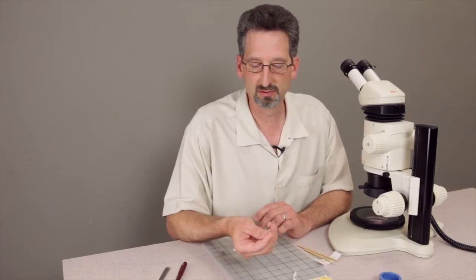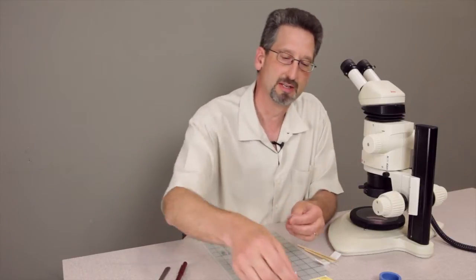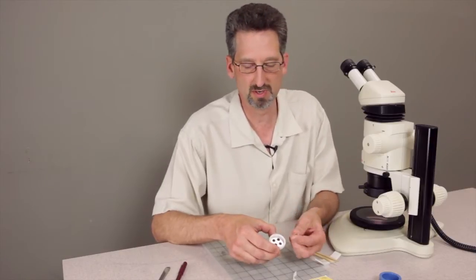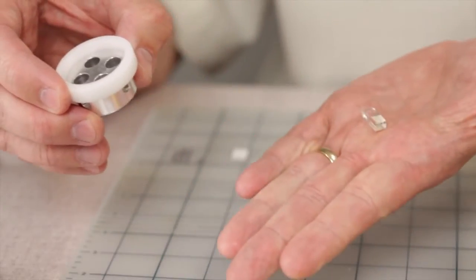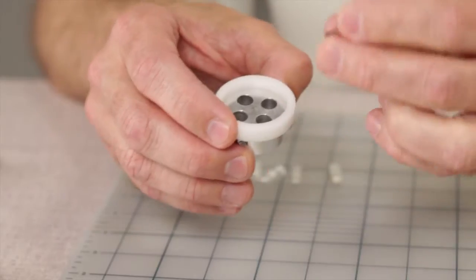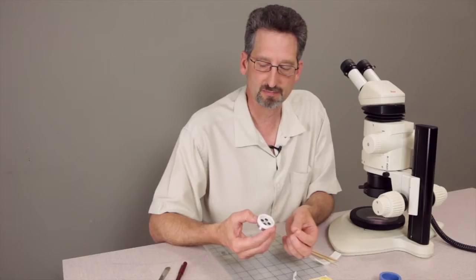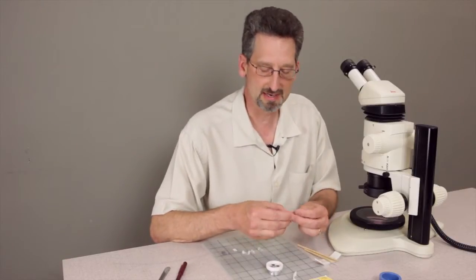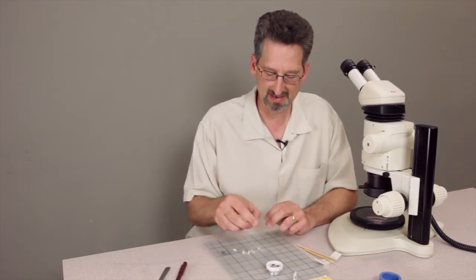We use a small sample capsule that fits inside a holder. Four of these tablets can fit inside the holder and then could either be polished by machine as the industrial ones are or by hand, and we'll get to that in a minute.